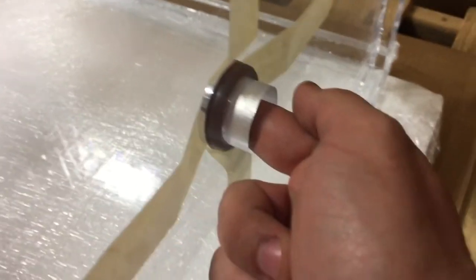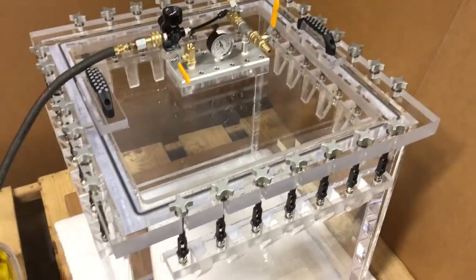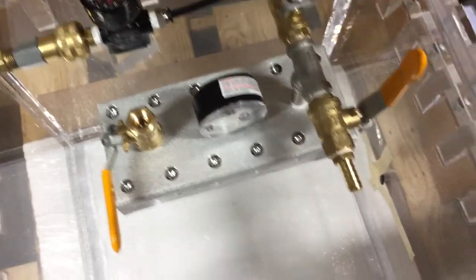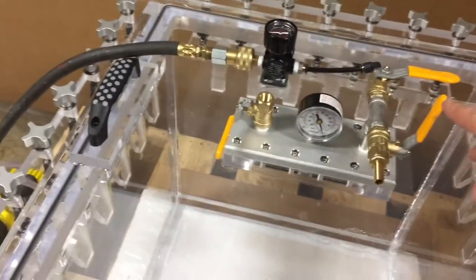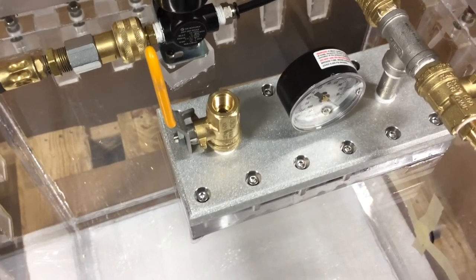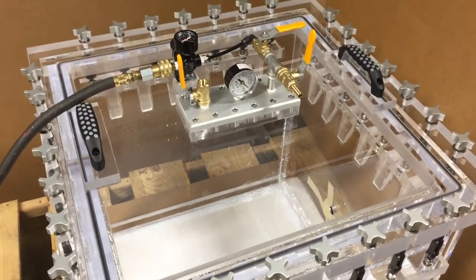Let me prove to you that you do have pressure — when I press on this you can hear air coming out. So just give it some time and you'll be at about 2 psi. To release the pressure, all you have to do is open the vent valve and the pressure is released. Thank you very much and contact us if you have any questions.